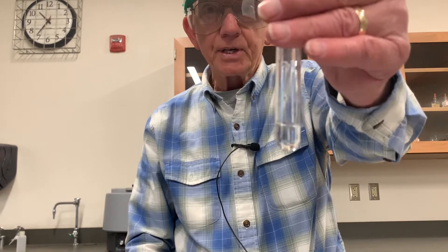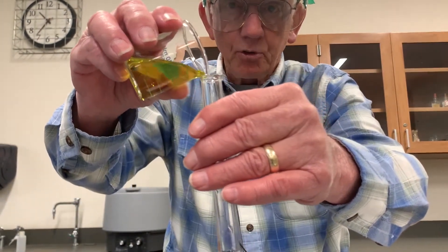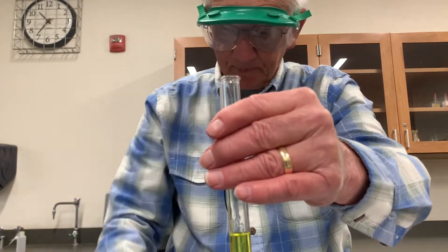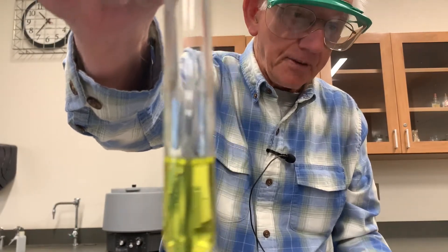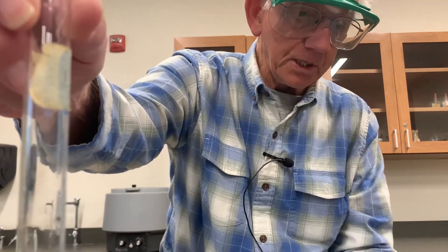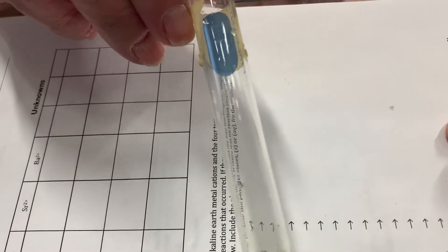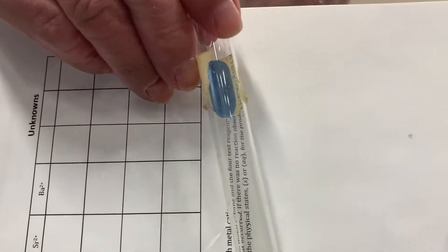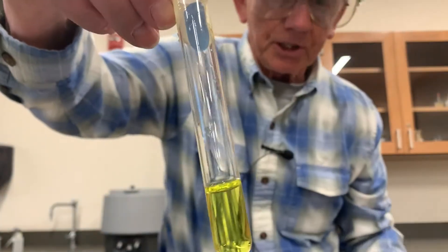So here is magnesium nitrate with a little bit of potassium chromate. Your concern is: is there a precipitate forming or any unusual color change? One way you can tell — if you can read the letters through the solution, then you know there's no precipitate in there. That's called the Tyndall test.